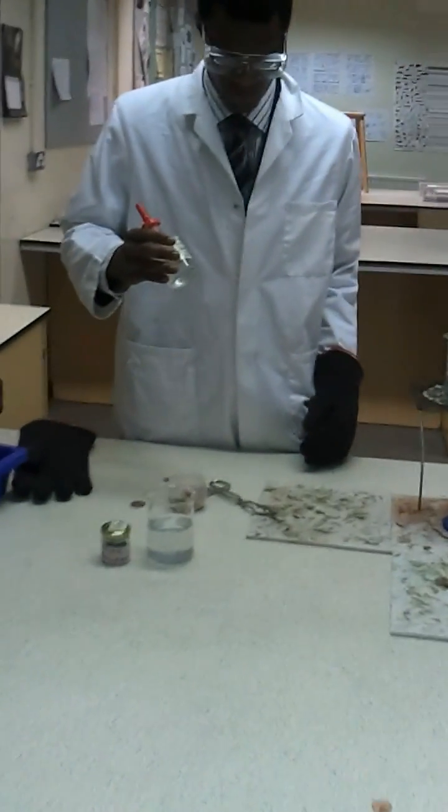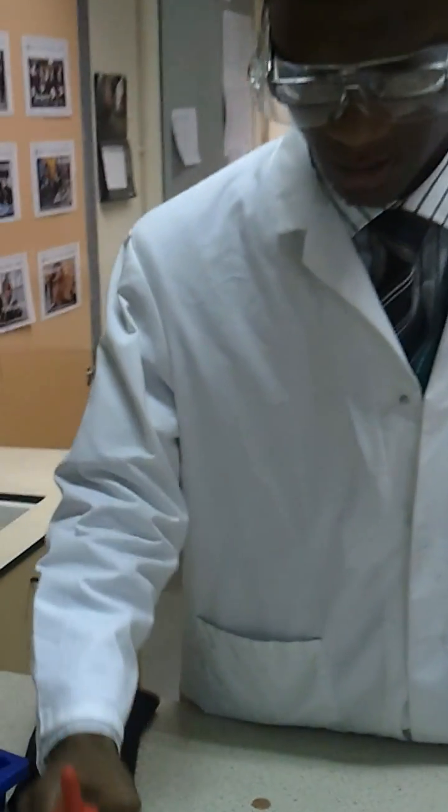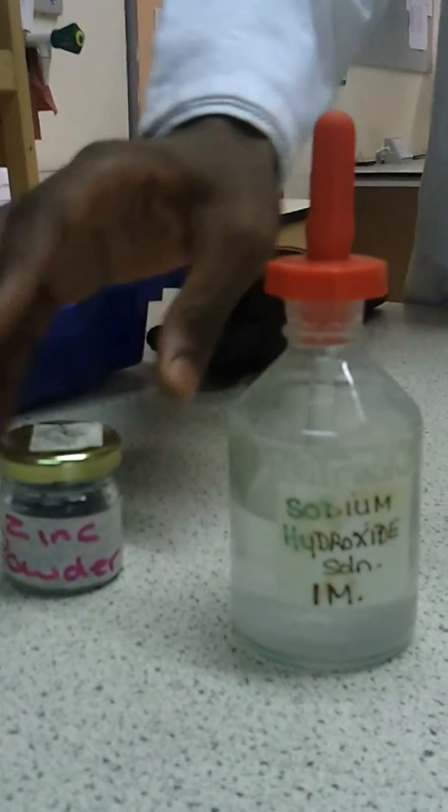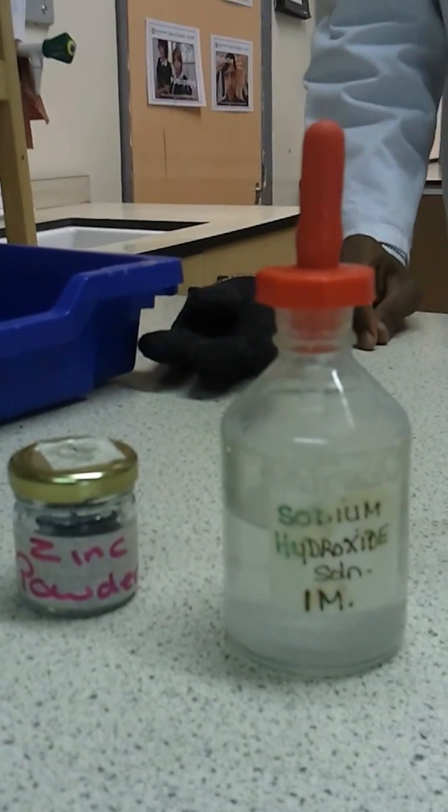So this sodium hydroxide is just one molar, just ordinary zinc powder. You don't need much.